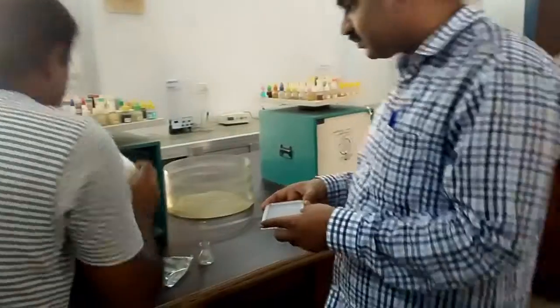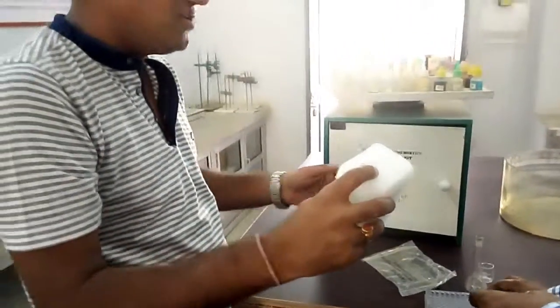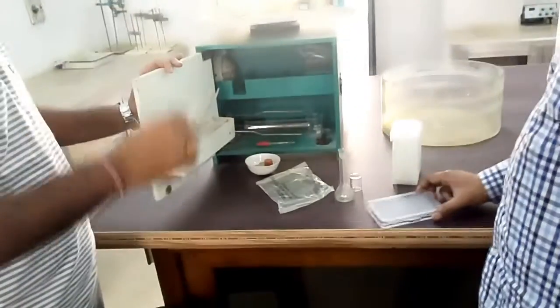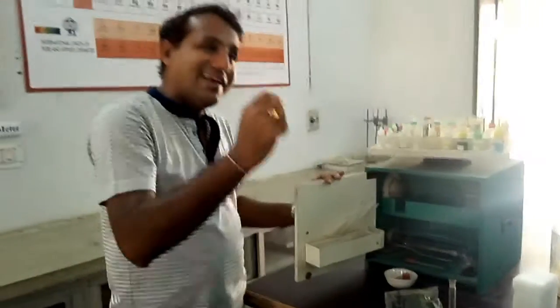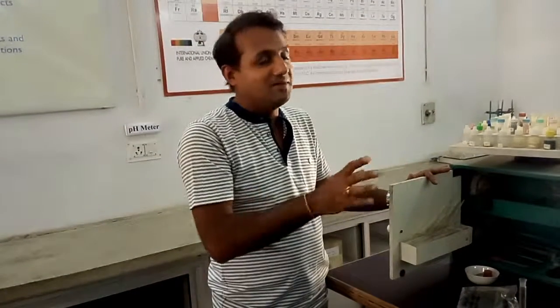You can perform the heat of neutralization or thermometric titration experiments. In fact, all the experiments can be performed with just this kit. It includes litmus paper, capillary tubes, a thermometer, and whatever else you need — all available in place.